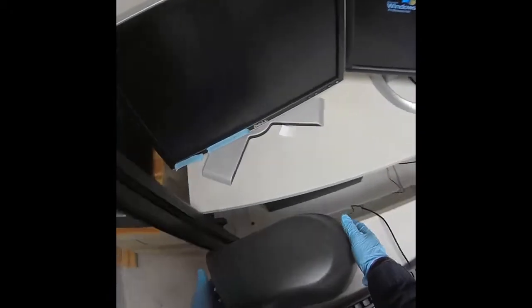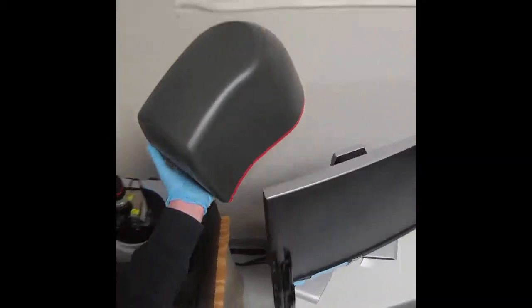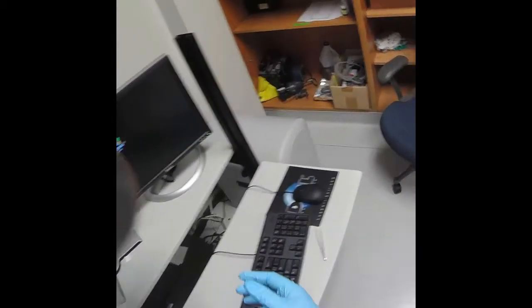We're not going to put the cover on yet because we want to target our sample before we put the cover on and start scanning, to make sure we scan in the right place.